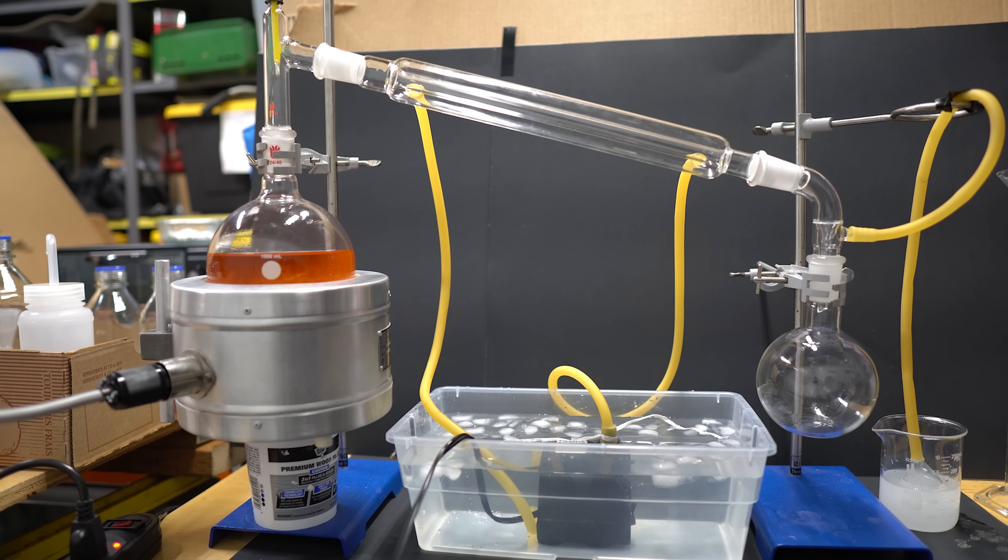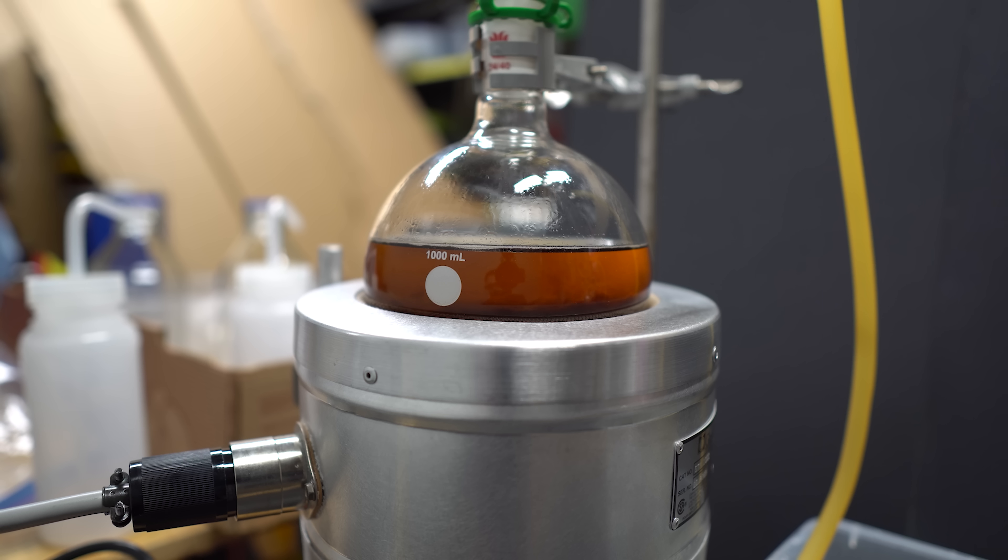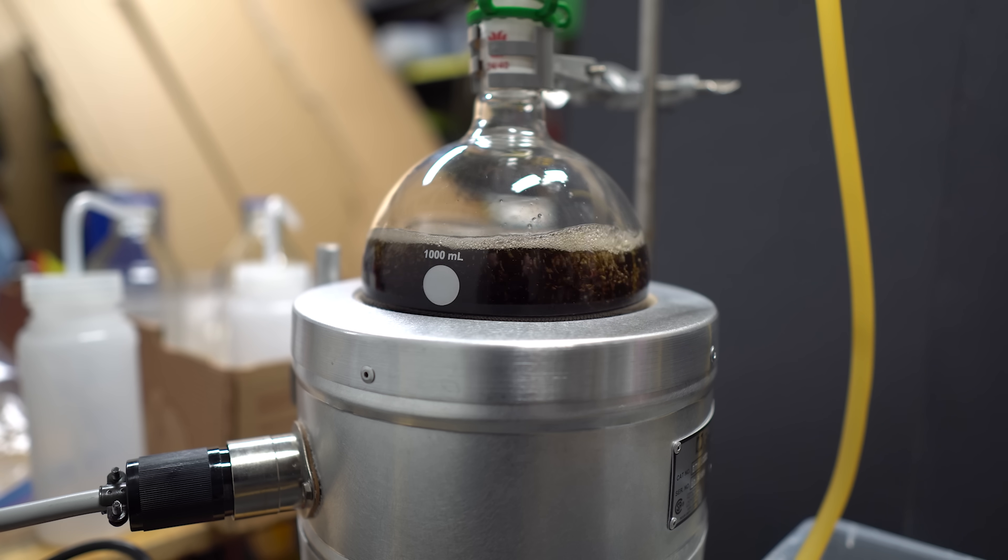As the solution started to heat up, you can see that it's slowly starting to get into a darker color. Now, eventually, as the distillation progressed, it got pretty dark. It actually reminded me of Coca-Cola, and apparently, there was a lot of soda chemistry going on in this video.